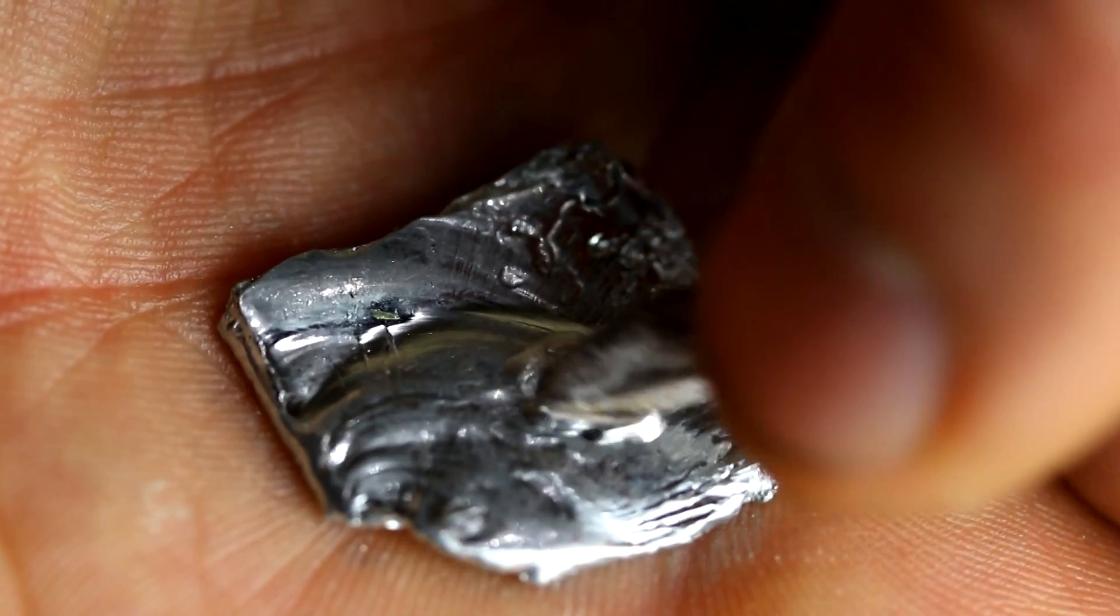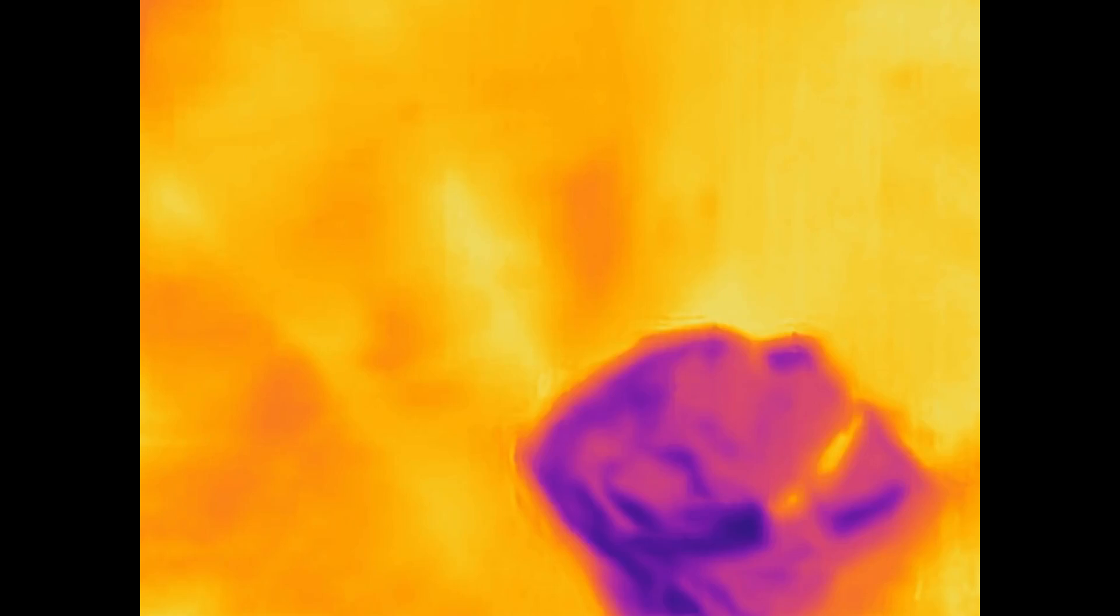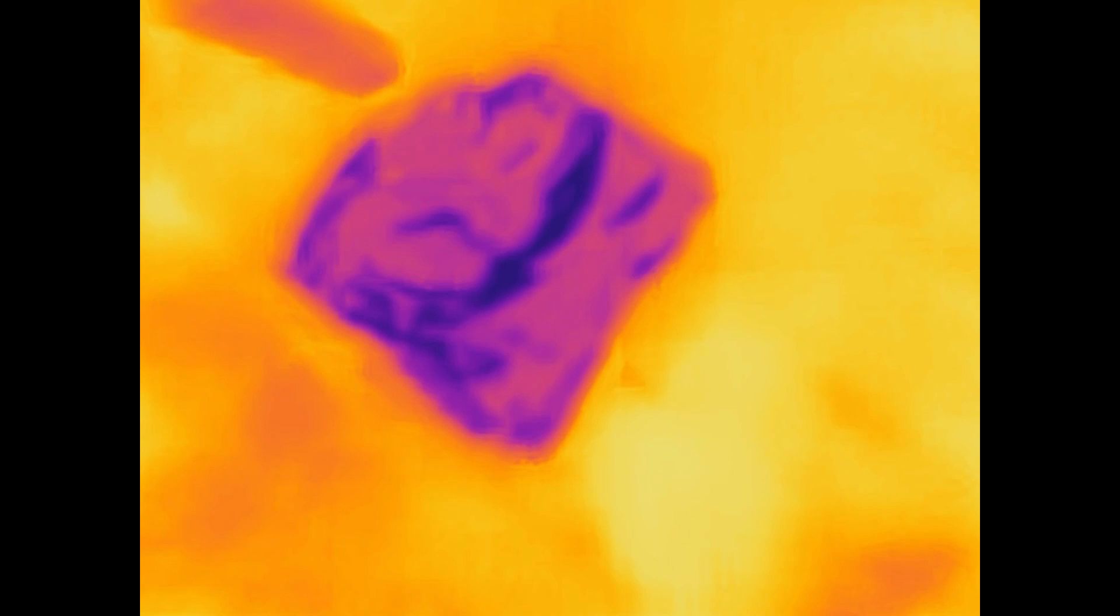Now I can actually feel that the metal got colder. If we watch this happen with a thermal camera, you can see the metal here. And now let's combine it with the indium.